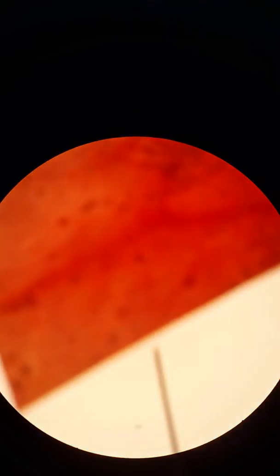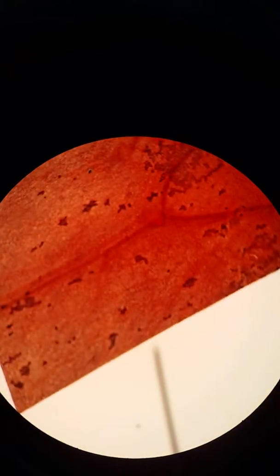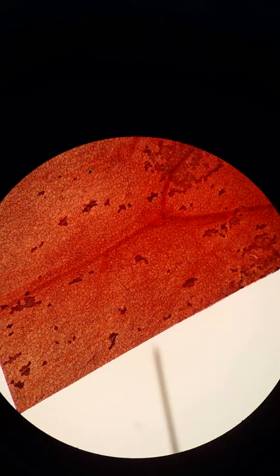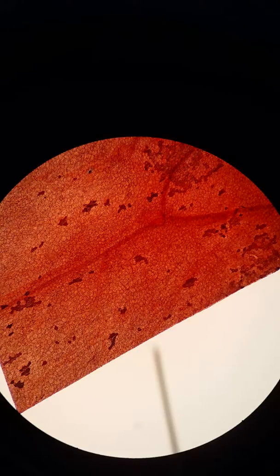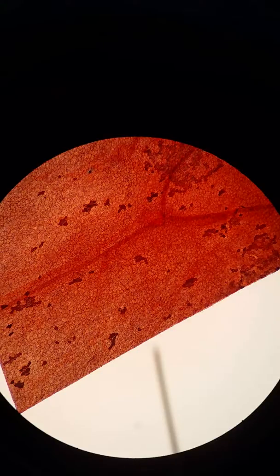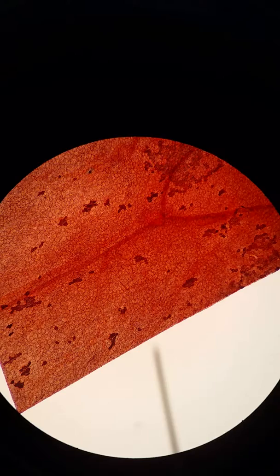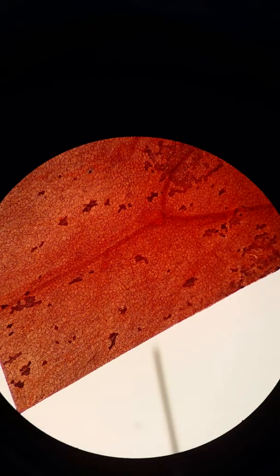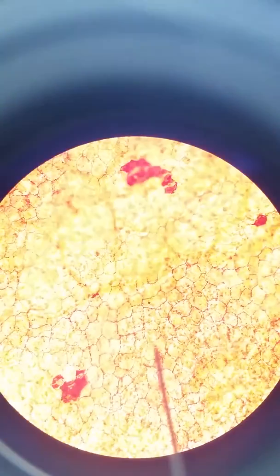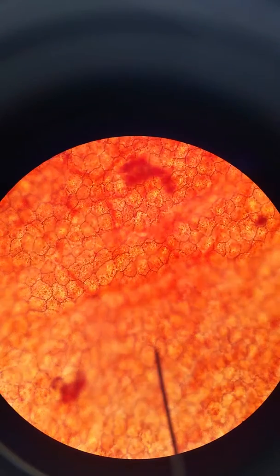We'll go to medium power and see if we can start to make out the cells. Each one of those big black dots is not what we're actually looking at — the small little circles that we're seeing within there are actually going to be our cells. So we'll go up to high power and see what we can see.